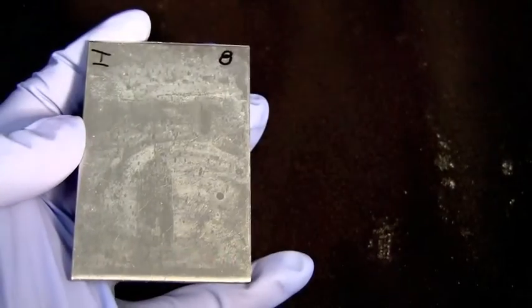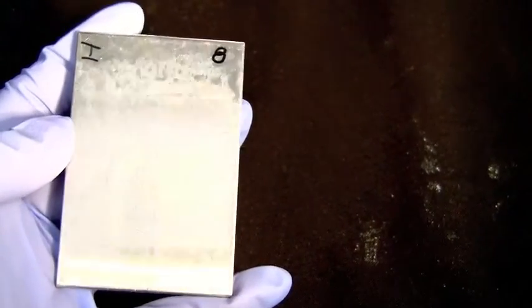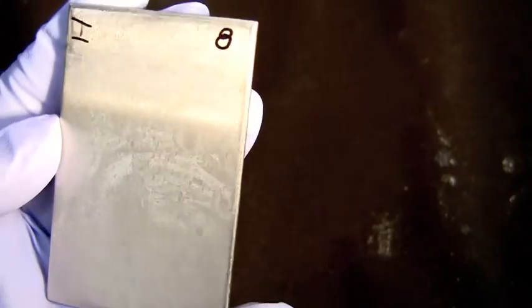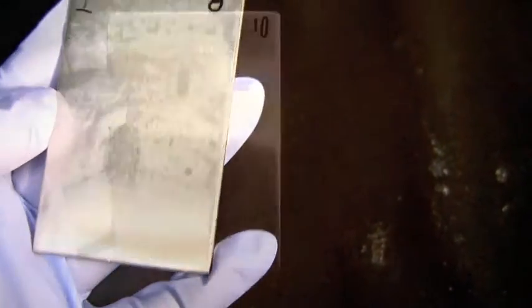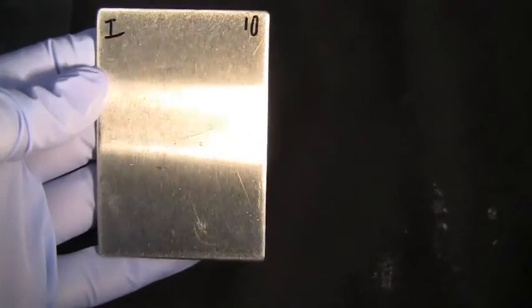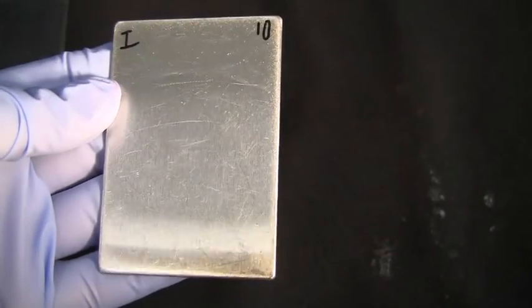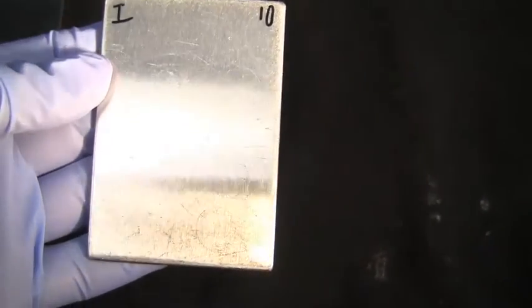Coupons are then permitted to dry and the surfaces are examined under intense light to review the surface for any haze that may remain. Coupon trials that result in water break free, visually clean surfaces are then repeated to ensure consecutive successful results.